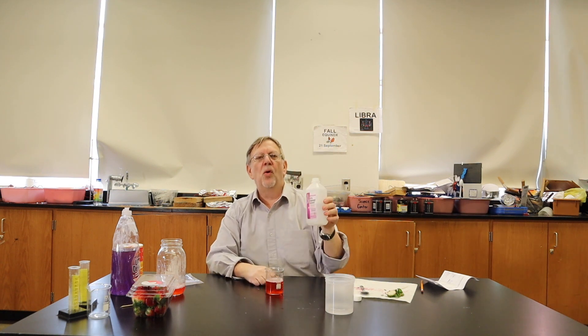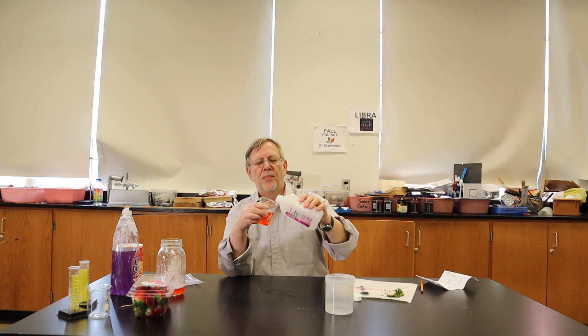And as we gently pour it in, the DNA should begin to separate because alcohol is less dense than water. Alcohol will float, taking the DNA up with it. So we are going to gently pour in some alcohol.